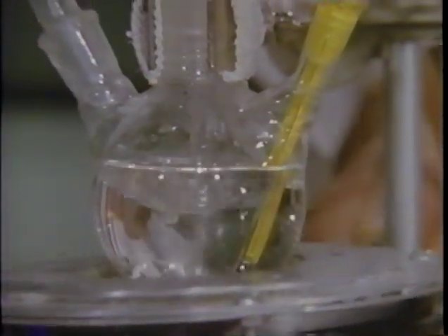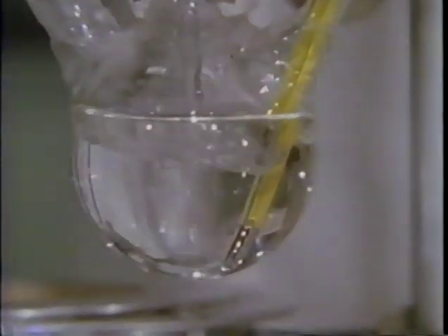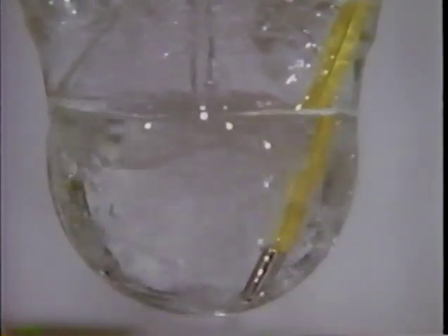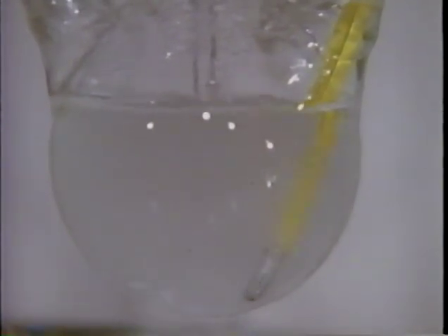Since the reactants are almost insoluble in one another, they form two liquid layers. In order for the rate of reaction to be appreciable, we must mix the reactants by increasing the stirring rate. The cloudiness indicates the presence of tiny droplets of ester suspended in the water solution. The droplets give a large area of contact between the water and the ester, and the rate increases.